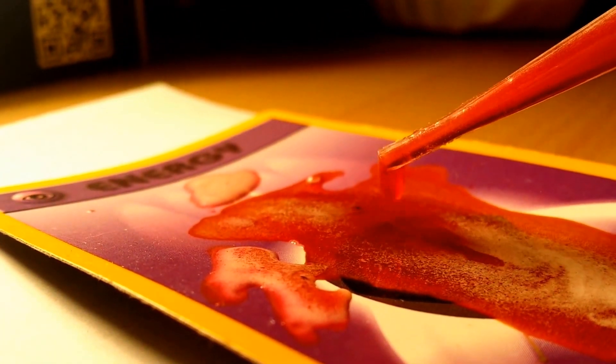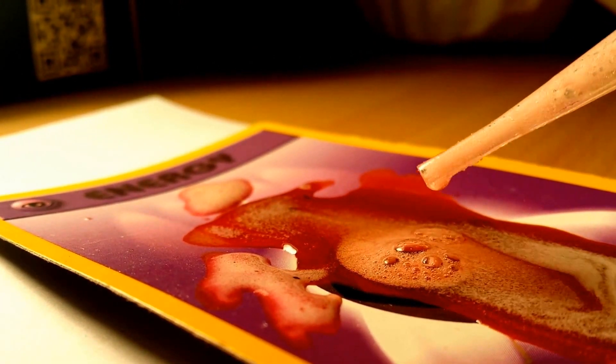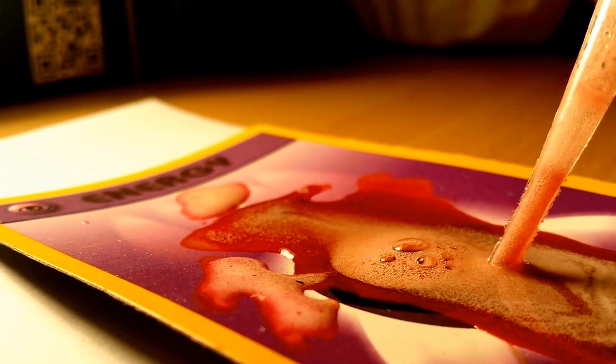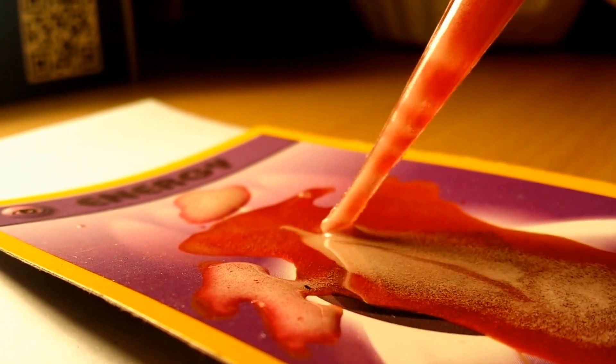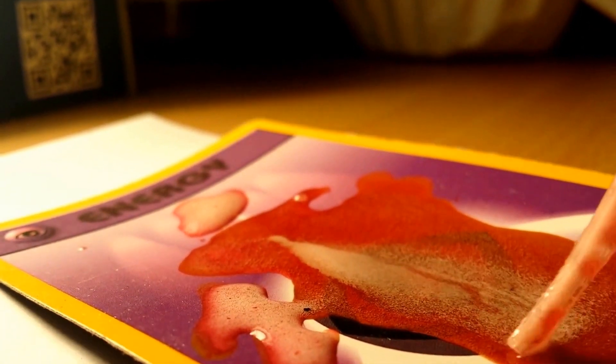Oh, dripping some out. Looks like blood almost. Very foamy.